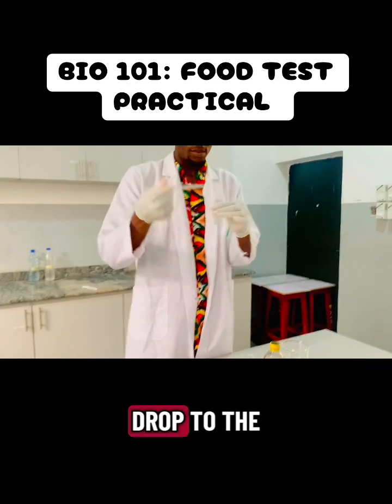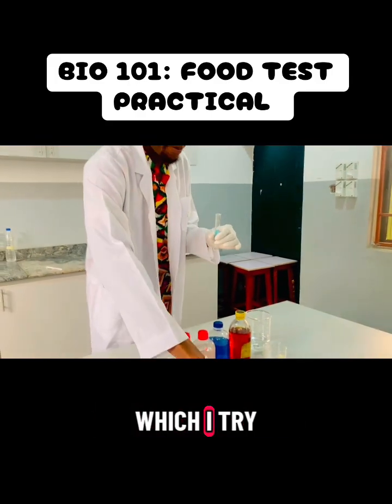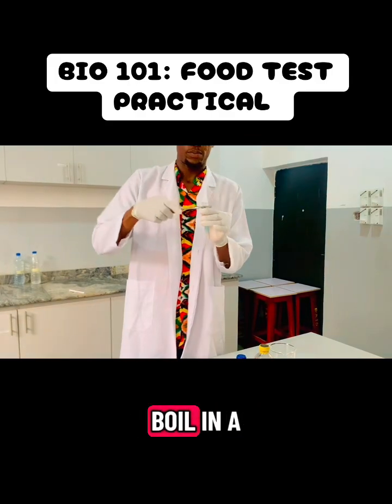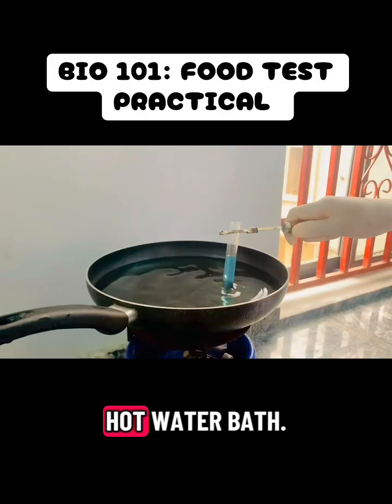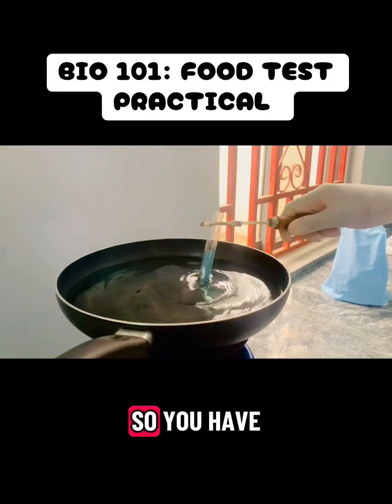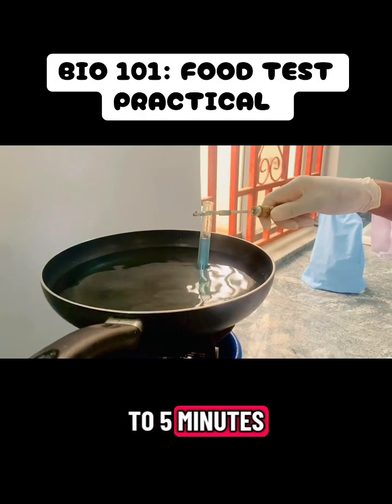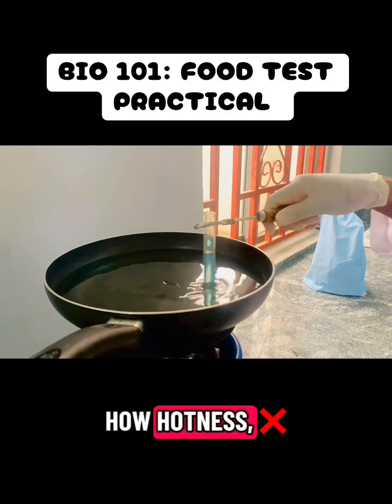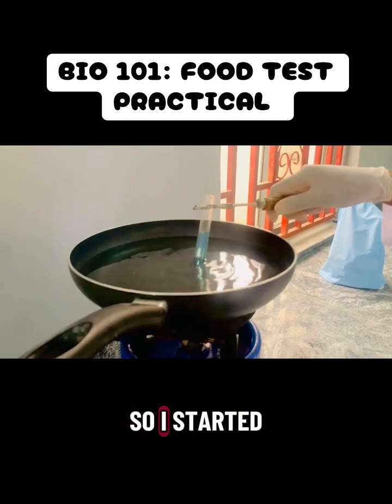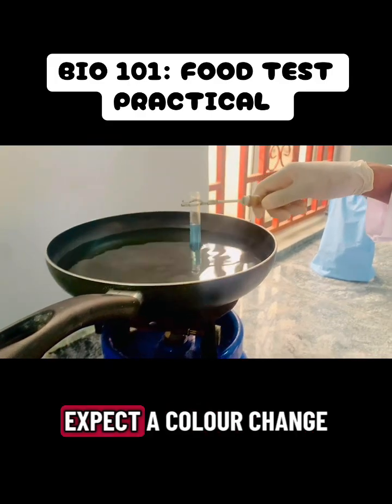So this is me adding a drop to the food sample, after which I boil it. You have to boil in a hot water bath. Pardon me, I'm using a frying pan. You have to boil for at least 3 to 5 minutes, depending on how hot your water is. So I started from scratch here, and this is us boiling, expecting a color change.